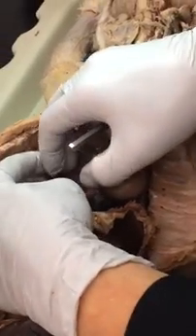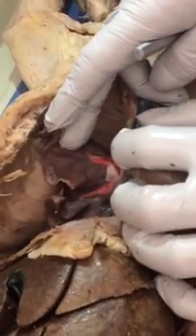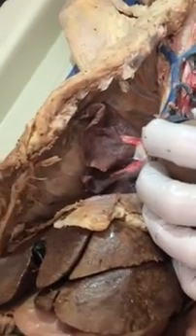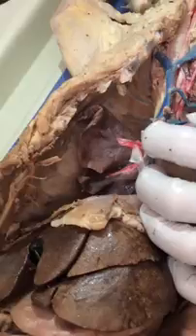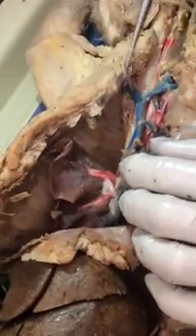Alrighty. External jugular. Oh, pulmonary veins look really good. Come look at that, even though they're red. Hey, Kat, you want to see these pulmonary veins? Those are veins. I don't think we have arteries. It's not on the side, it's on the lung. Pulmonary artery is the pulmonary trunk.